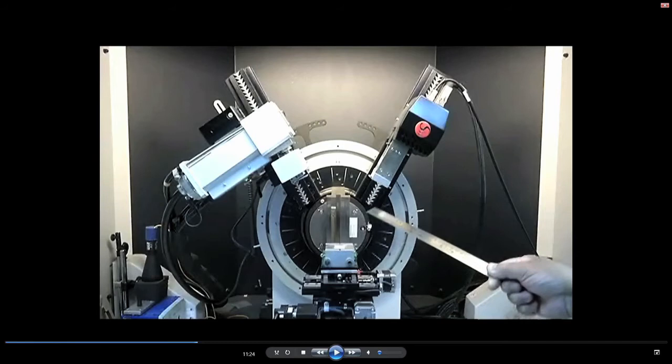Similarly, the detector also will have a lot of slits and filters. Please remember, we are interested in taking only a particular X-ray beam, for example K alpha, and in general, without the slits, you will also come across K beta and so on. The other radiations are blocked by these filters. For example, K beta is suppressed. You cannot eliminate it completely, but it can be substantially suppressed as compared to K alpha radiation. The filters are here, and this is a detector. It could be a semiconductor device as well.